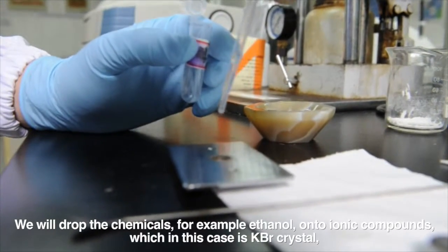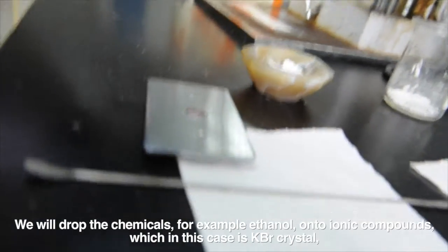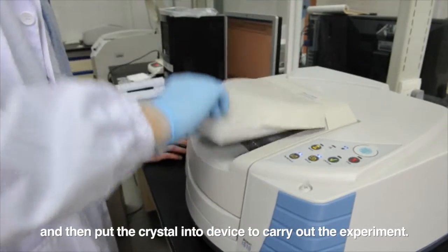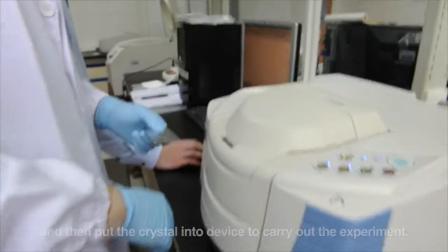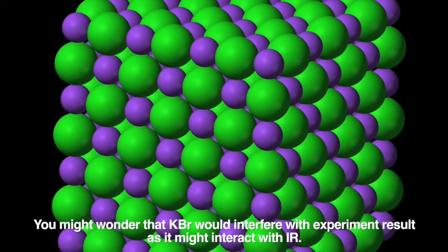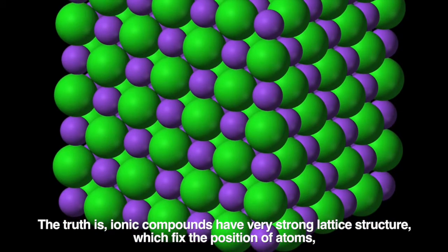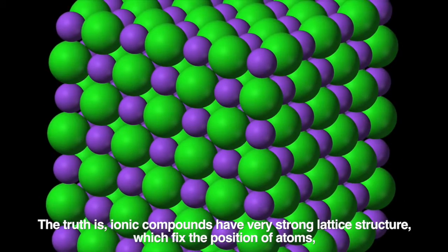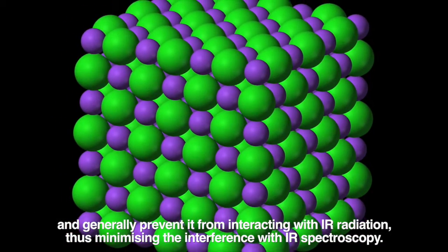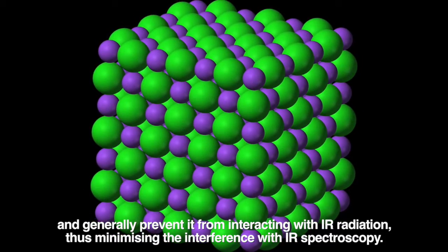We will drop the chemicals, for example ethanol, onto an ionic compound, which in this case is potassium bromide crystal, and then put the crystal into the device to carry out the experiment. You might wonder whether KBr would interfere with the experiment result as it might interact with IR. The truth is, ionic compounds have a very strong lattice structure, which fixes the position of atoms and generally prevents them from interacting with IR radiation, thus minimizing the interference with IR spectroscopy.